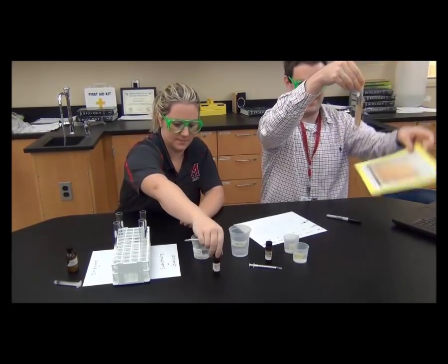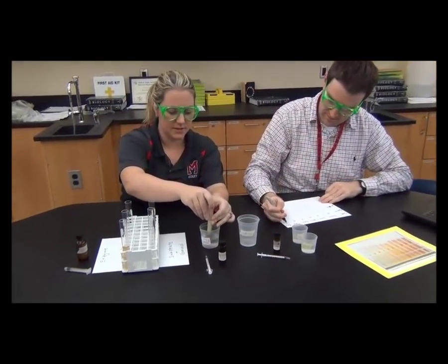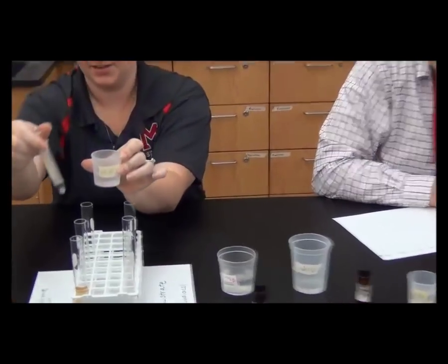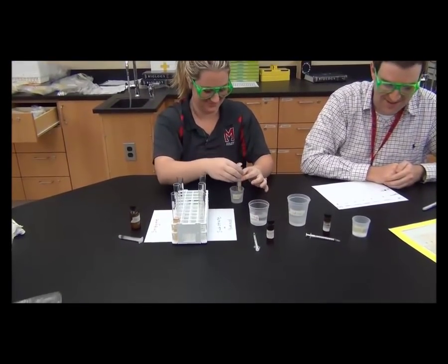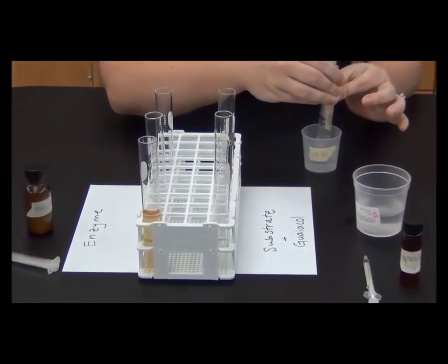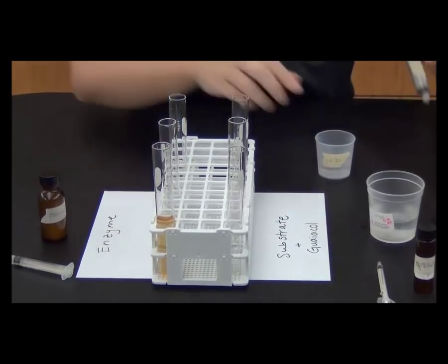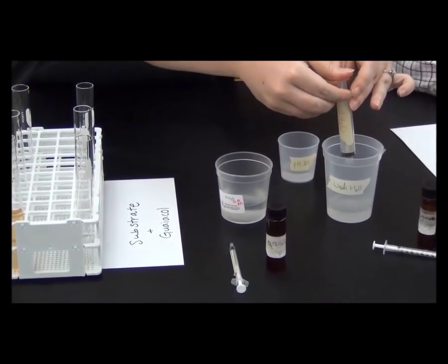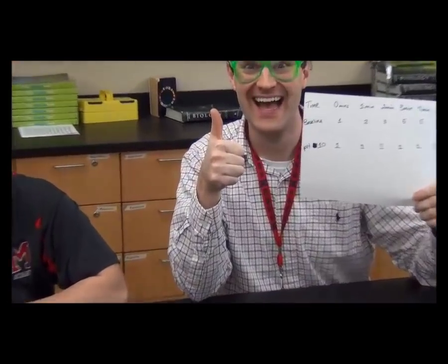You're going to have a chance to use different pH environments to see how that affects the enzyme. We only have one syringe that can load the pH — we use the water syringe for that. You always want to add the six milliliters of pH solution to the enzyme tube, since we want to see how pH affects the enzyme. In between using different pH solutions, you need to flush out that syringe with water so you don't contaminate the different pH solutions — just draw up some water and flush it into a waste cup. We hope you enjoy this lab, and you can see the quick results we got from our two experiments.